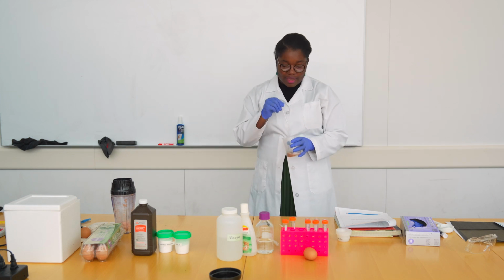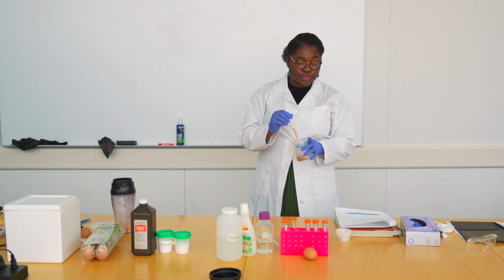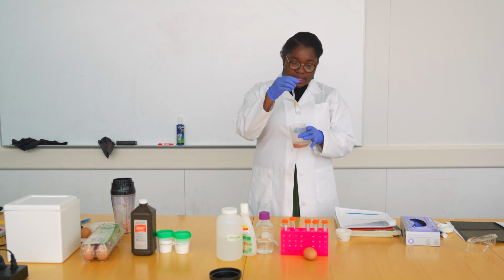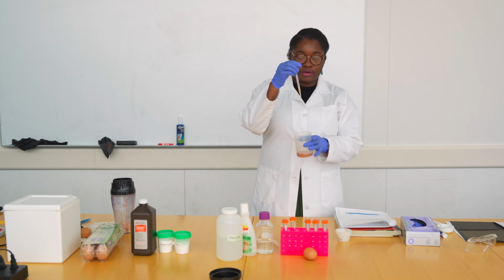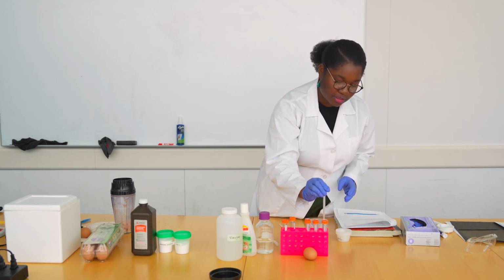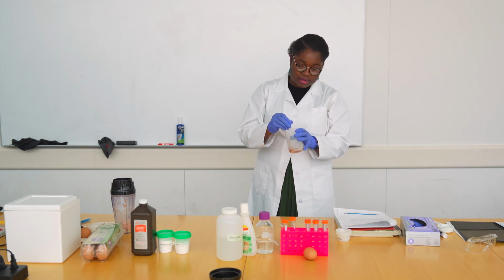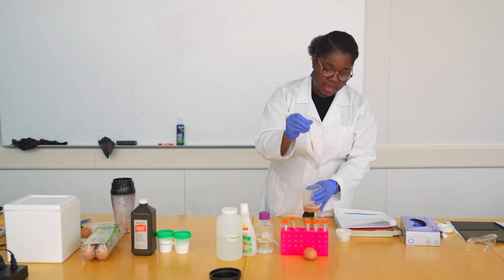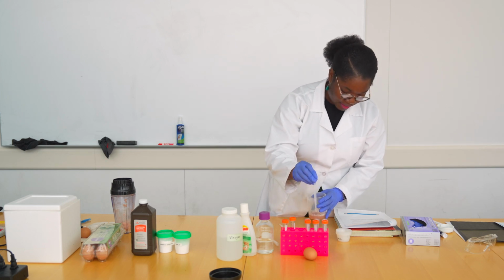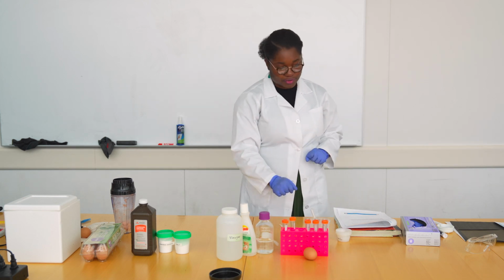Here I'm going to add 10 drops of potato juice to our first 2 tubes. And these 10 drops are about 1 ml. I told you earlier, your pipettes are graduated, so you could measure exactly how much you need. There we go, 1 ml, sorry, not 10. Second, another 1 ml of potato juice. And the third one does not have potato juice, as you can remember.